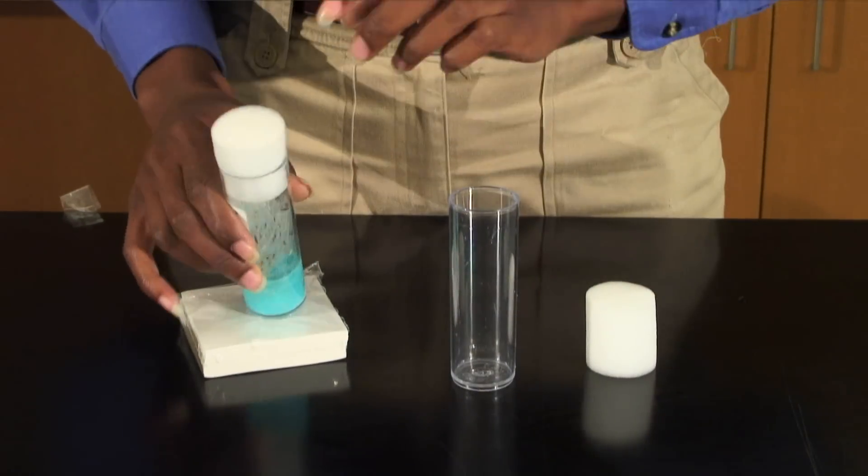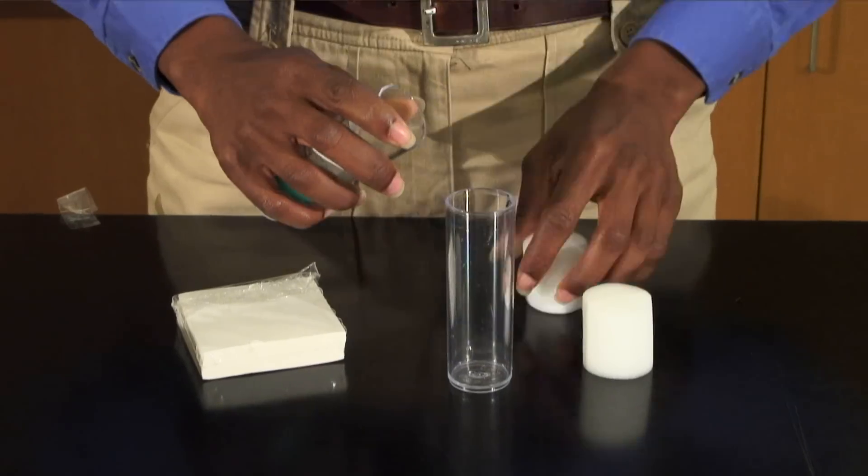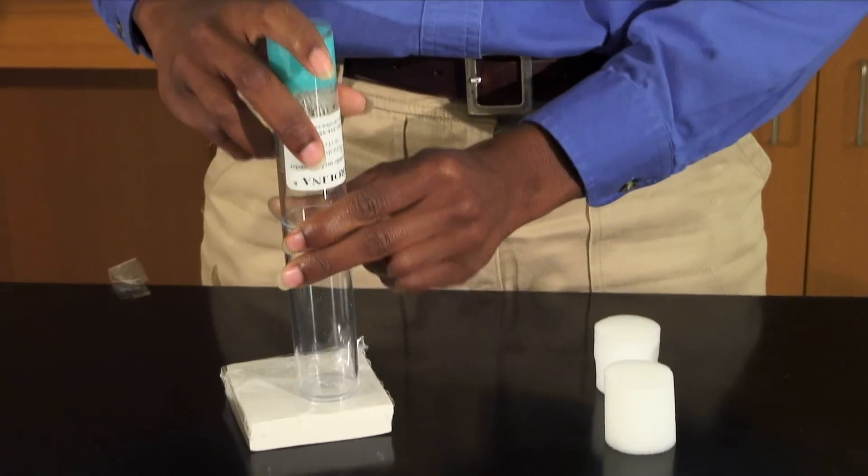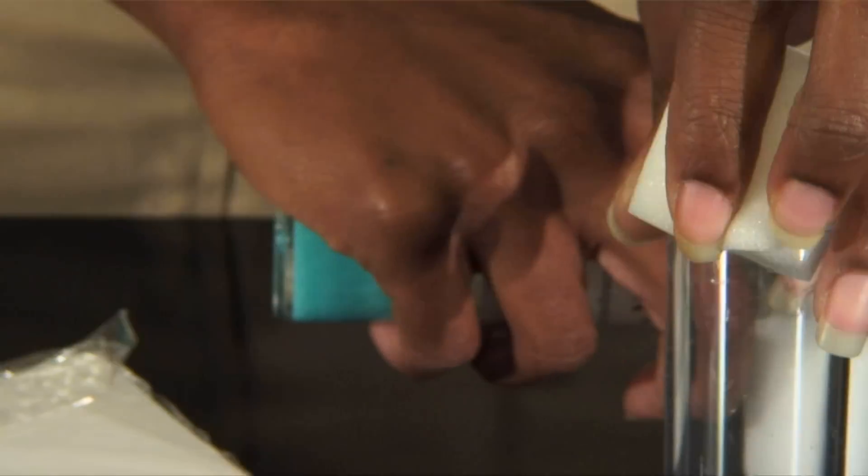When anesthetizing fruit flies in an empty vessel, gently tap the bottom and sides of the culture vial on a padded surface to move the flies to the bottom of the vial. Quickly transfer the flies from the culture vial into an empty one and plug the new vial.